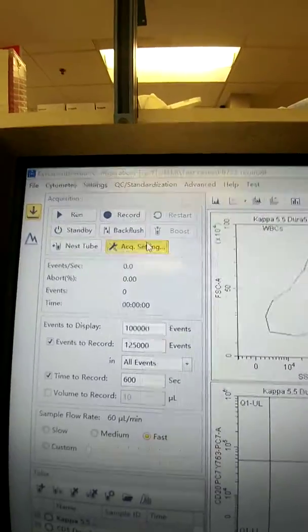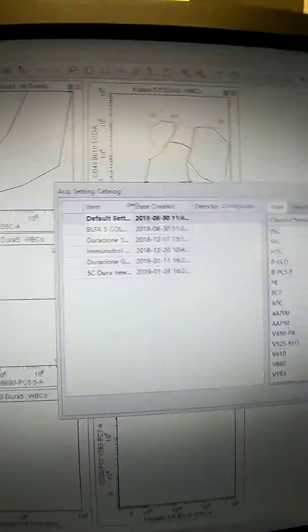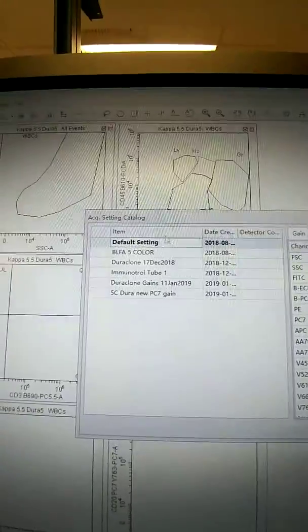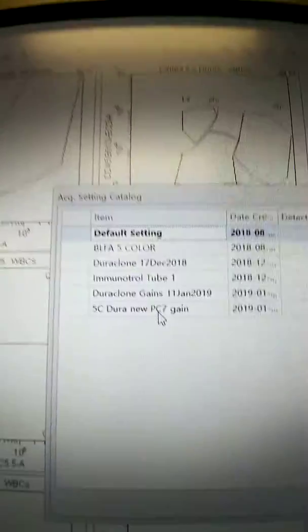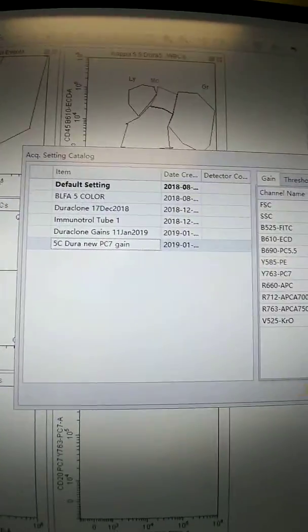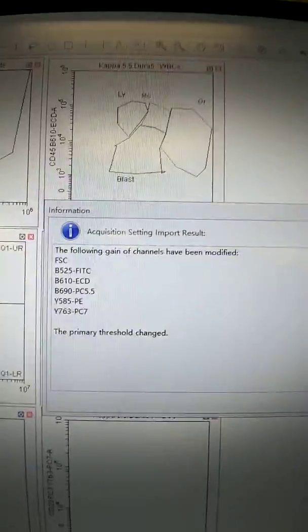So come up here to acquisition setting. So I'm going to import now from the catalog. I'm going to make the item column bigger. Okay, and I want to click this one, 5C Dura new PC7 gain. Okay, so I'm going to import that. It's showing me what's being modified. So click OK and close that.